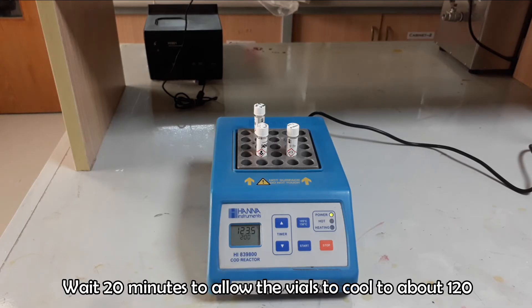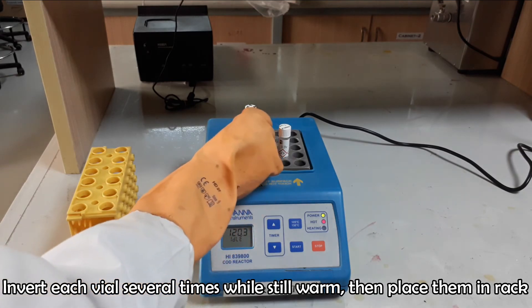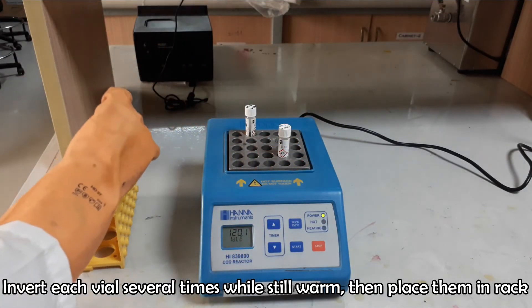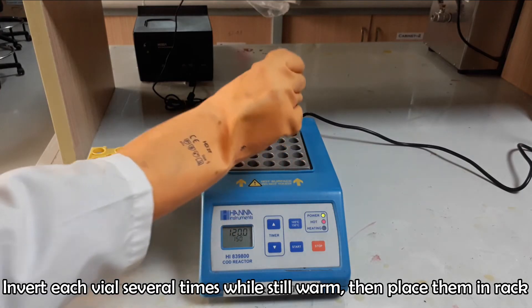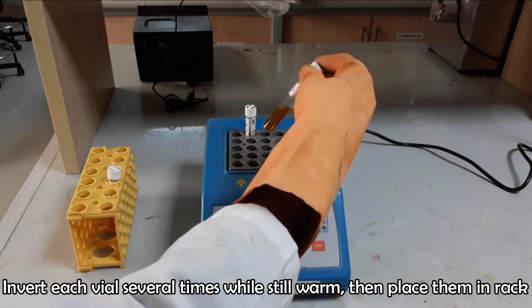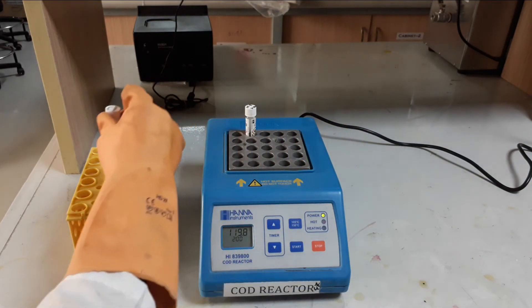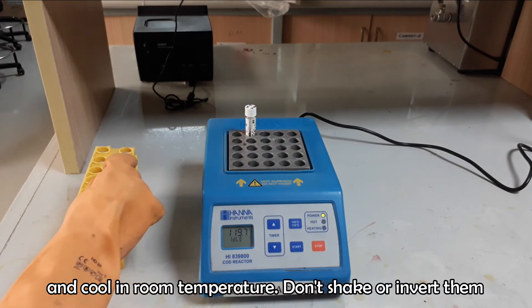After digestion, wait for the temperature to fall to 120 degrees Celsius, and then rotate the vials immediately for the last time. Then cool the vials to room temperature. Do not rotate or shake the vials after cooling because the sample may become turbid.